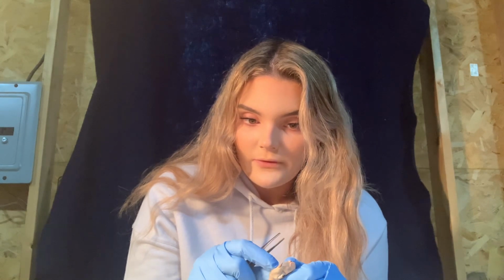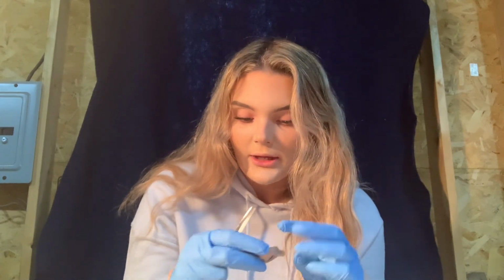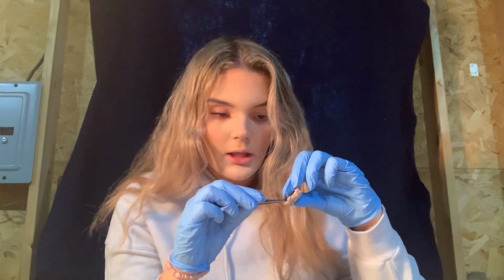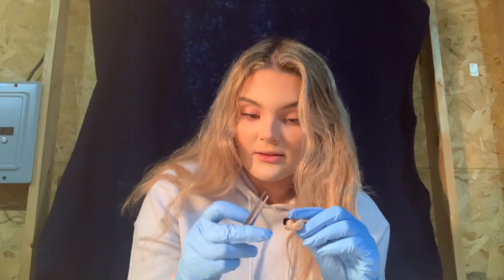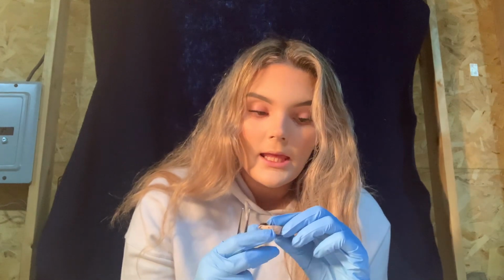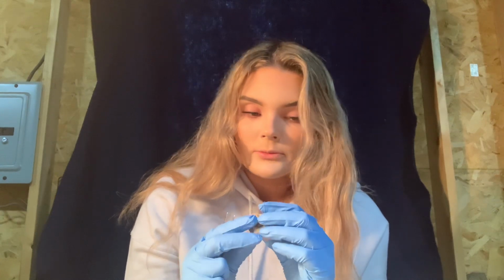And then we have the hyaloid fossa, which is the indentation where the center of the vitreous body supports the lens. So it's just where the lens sits, the indentation, which is the hyaloid fossa. The iris is in here with the eye, and it regulates the size of the pupil. Lens, this is the lens here, and it focuses the light coming through the cornea and the pupil.